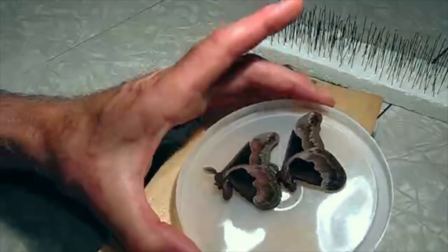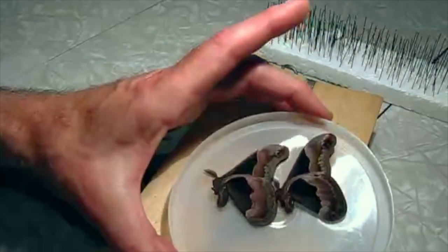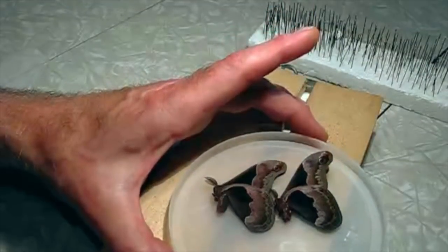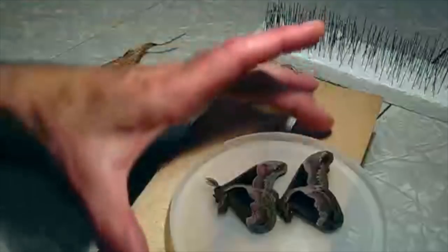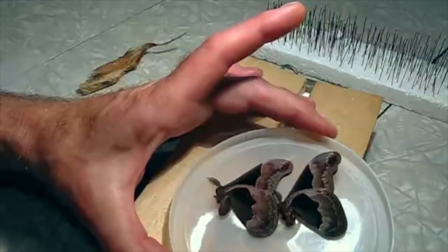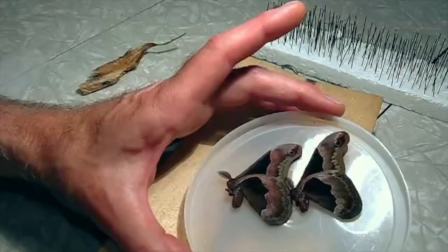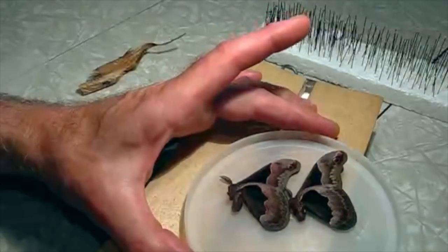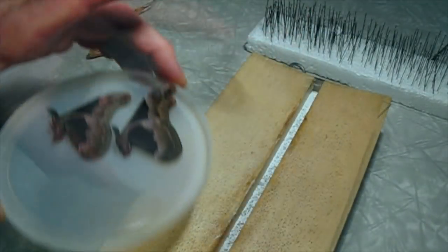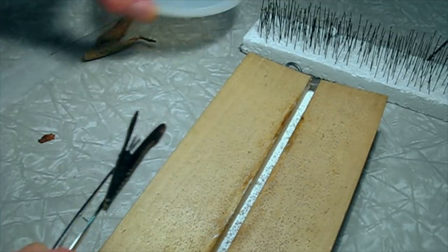Since I didn't have a pair, I'm just going to use them as specimens for my collection. These are fairly common and very easy to raise. The females look quite a bit different than the males — I'll show you later. It's called sexual dimorphism. So I'm just going to pin these up. I don't need to relax them; they haven't been dried, and they should be very easy to pin.